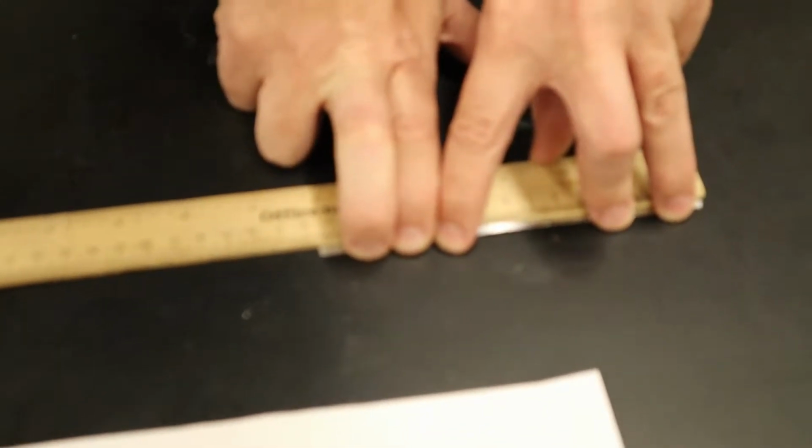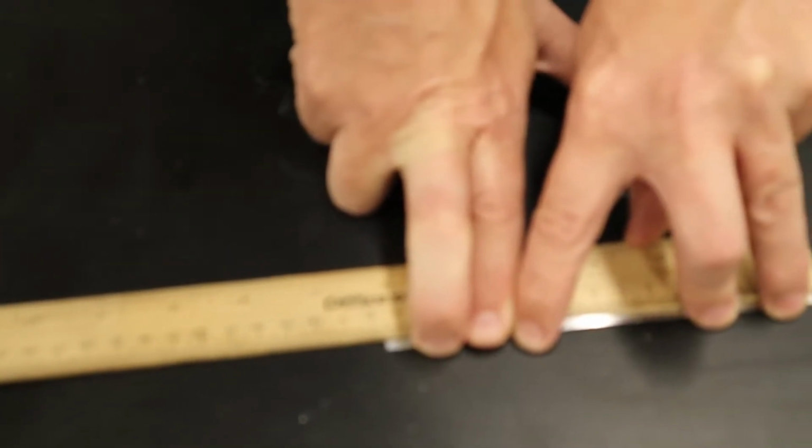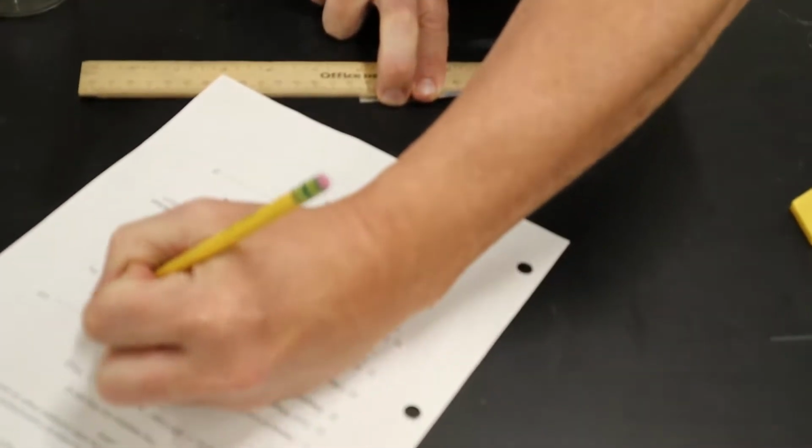All right, so the first thing we're going to do is measure out the length of your magnesium metal. So I'm measuring it in centimeters. Now remember, each line is 1/10 of a centimeter, so we got to estimate to the hundredths. And I would say that's about 15.57. That would be my estimation. It's somewhere in between the 15.5 and 15.6. So I'm going to say 15.57. So I'm going to write it down.